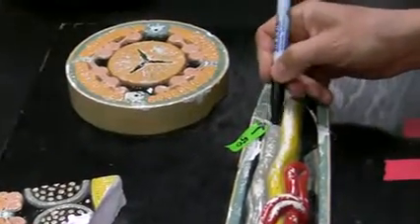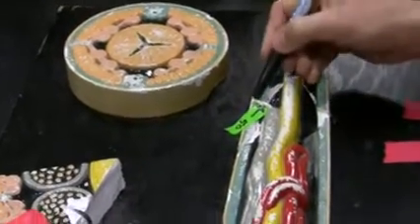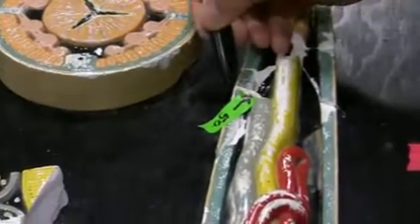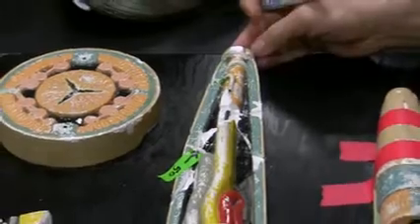So from here to here is vagina. You guys can see now. Question number 15, lab practical exam, I don't know when. But this is genital pore, and the three lips are right here. So we found the vagina, and then we said, okay, cut here, look at the three lips on the dissecting scope.